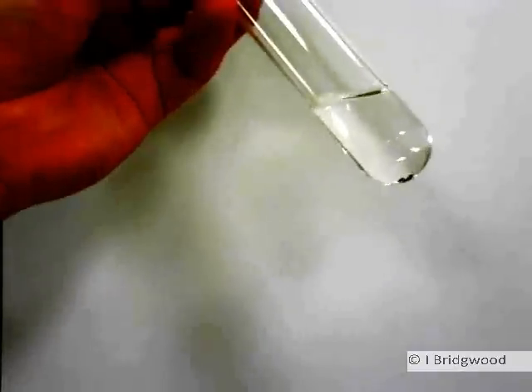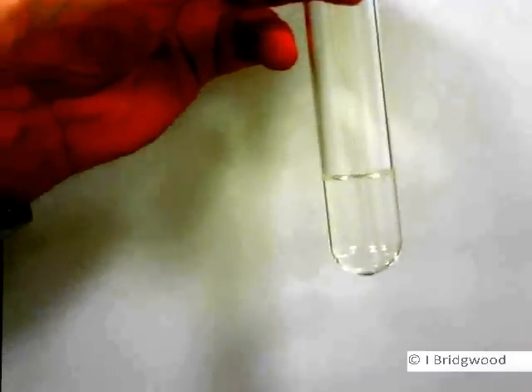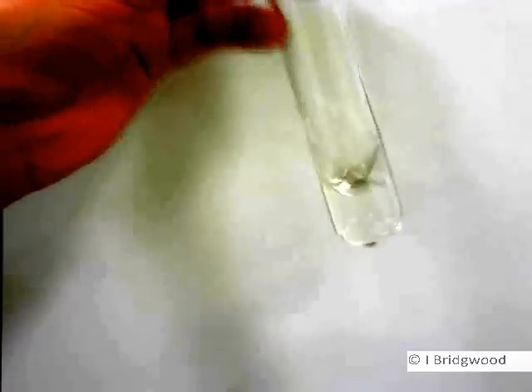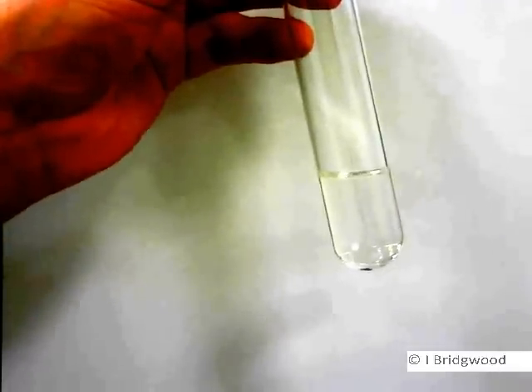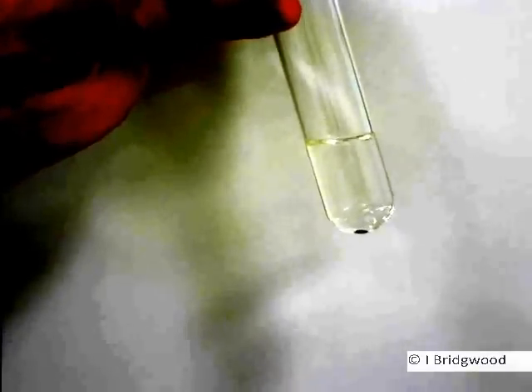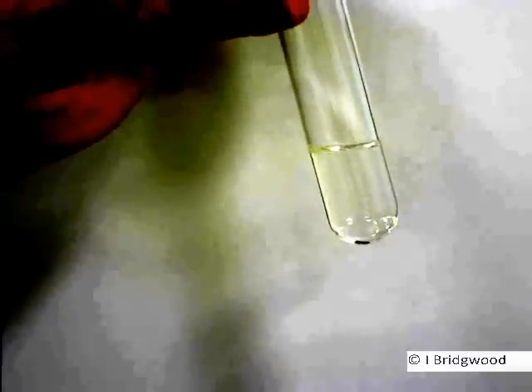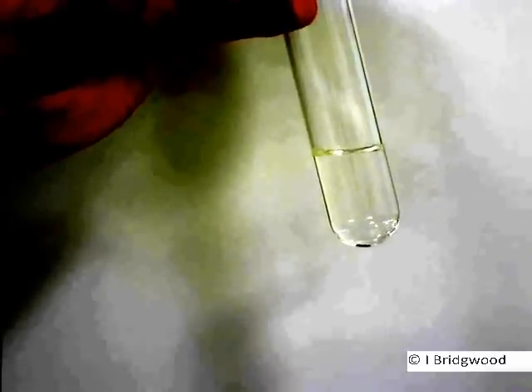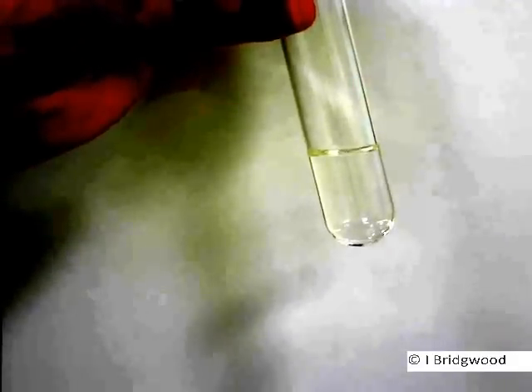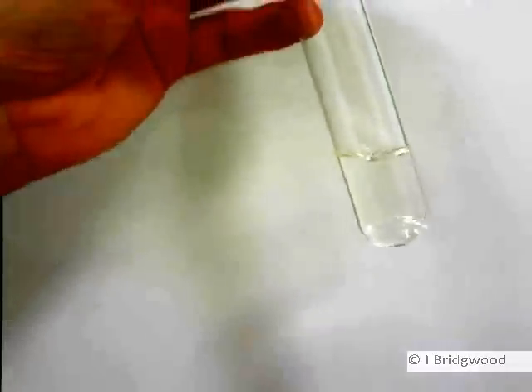Here I've got some iodine. You can just see the iodine there, sitting at the bottom of the tube, and it's sitting in water. Now, iodine and water are not mixing — iodine is not very soluble in water. The hydrogen bonding in the water molecules and the van der Waals forces between the iodine molecules mean that we're not going to be able to form strong enough interactions between iodine and water to overcome the hydrogen bond breaking between the water molecules that would be involved in taking the iodine molecules up. So, iodine is not really very soluble in water.